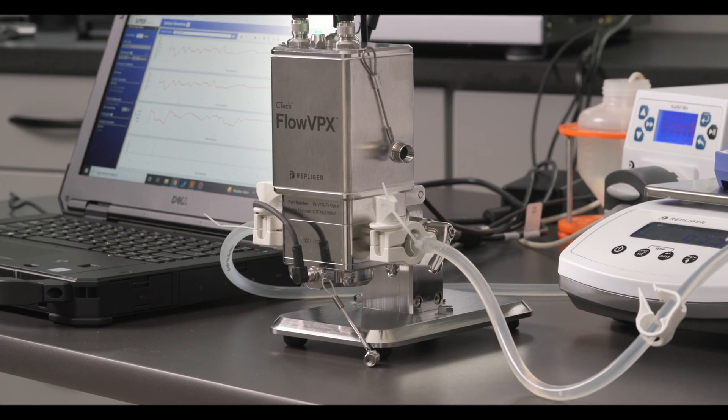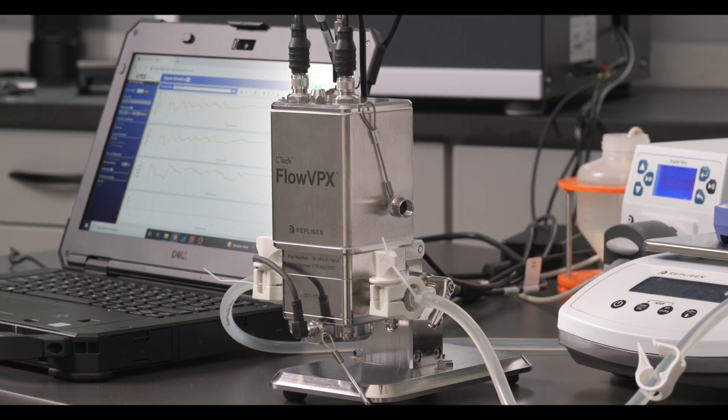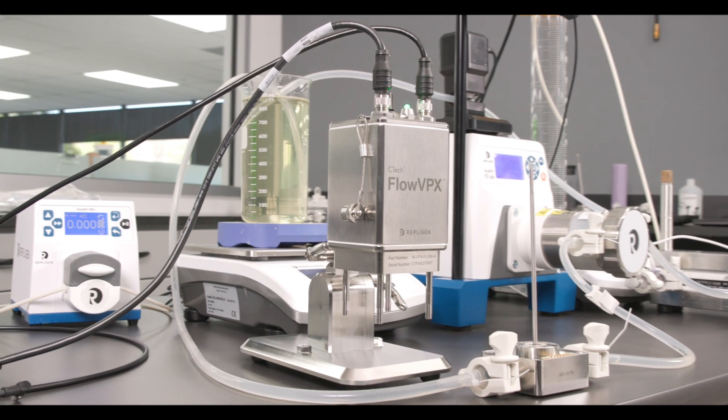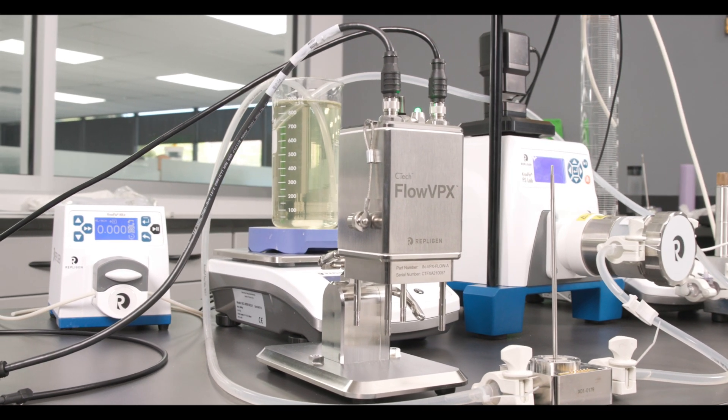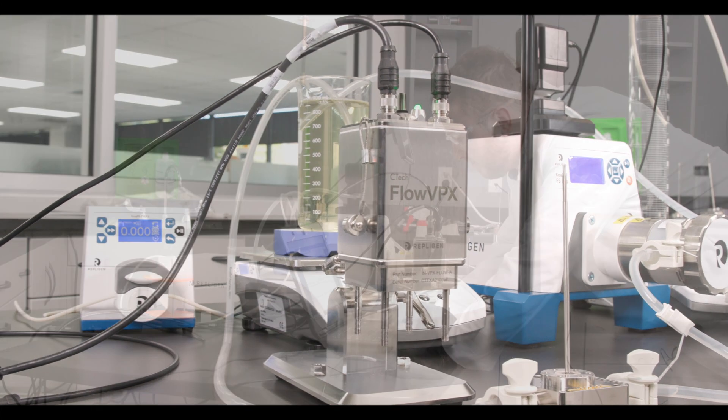The CTEC FlowVPX system provides accurate process control and monitoring in real time with minimal cleaning and maintenance. Today we will be covering how to clean and maintain your FlowVPX system after each run to prepare it for the next run and to keep the system performing at proper transmission level.